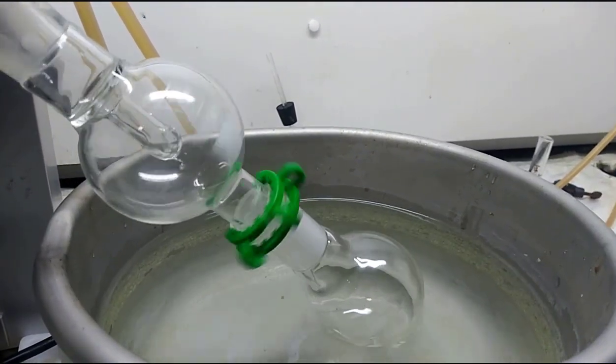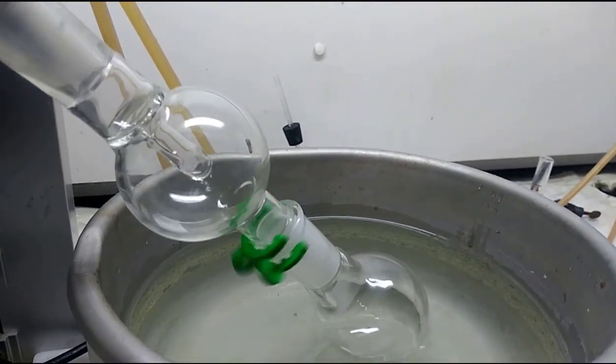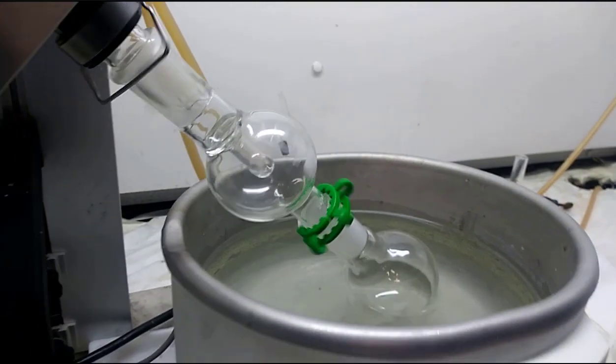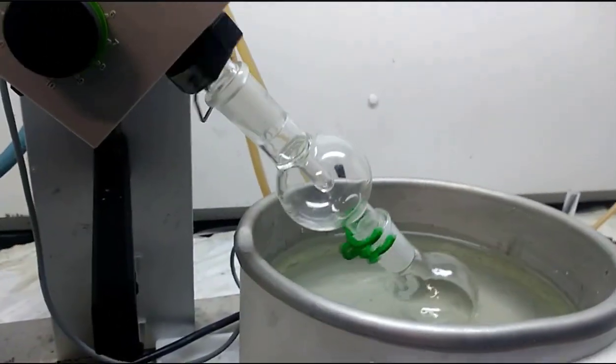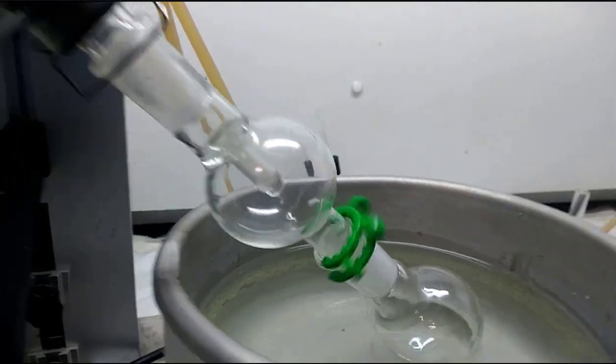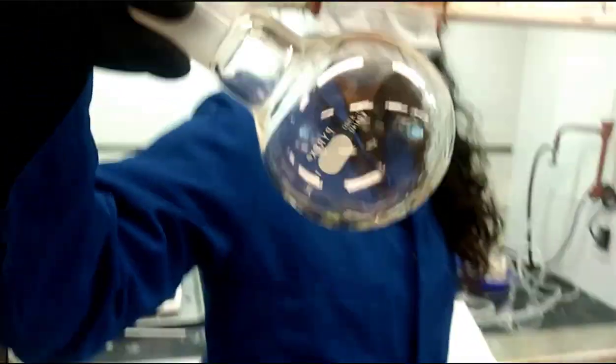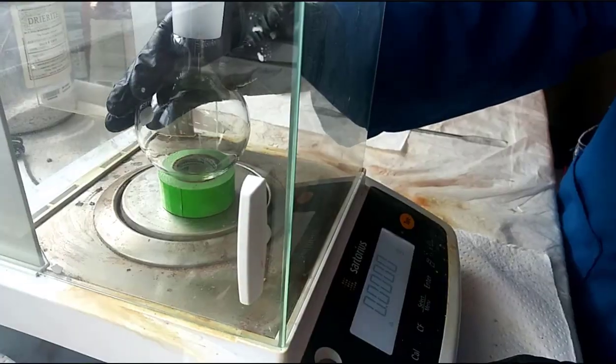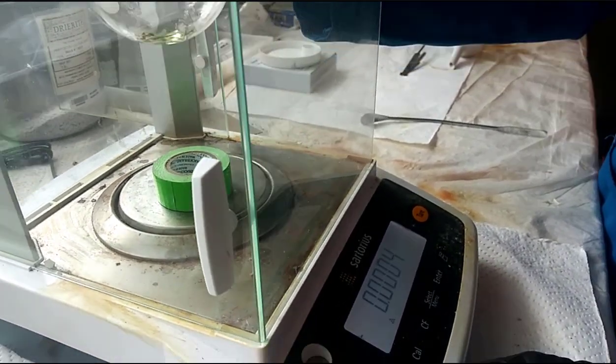What you're going to see here, your remaining product, the alcohol, is actually going to be a solution as well. The one thing to also be aware of is that it's not going to be easy to see, so do be aware of that. They're trying to show it to you. There's a teeny tiny little volume in there. That little bitty amount is your alcohol.